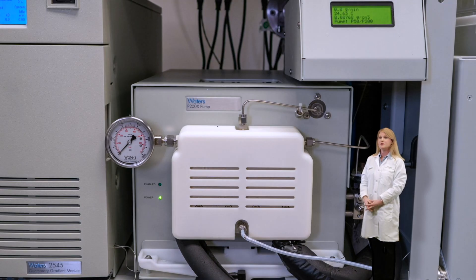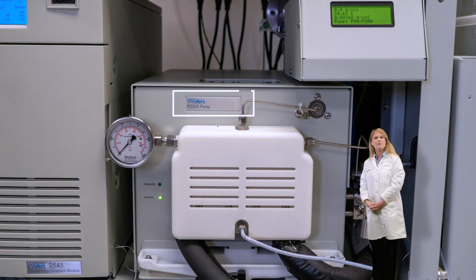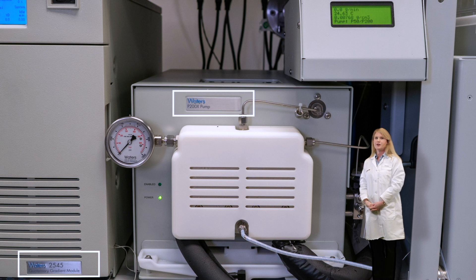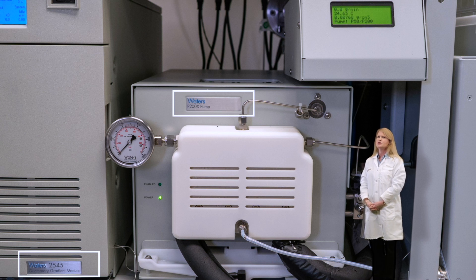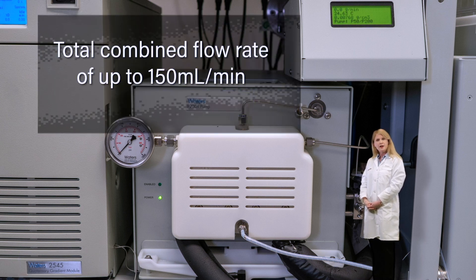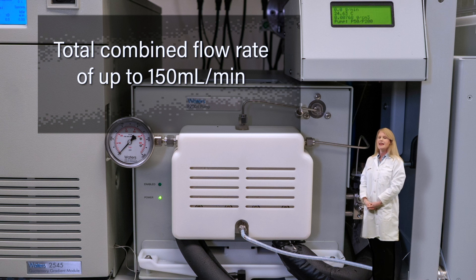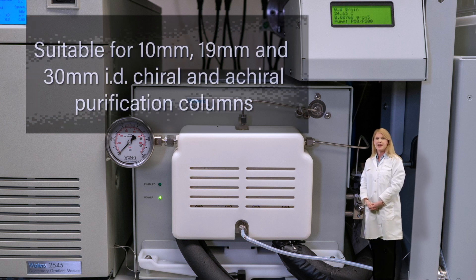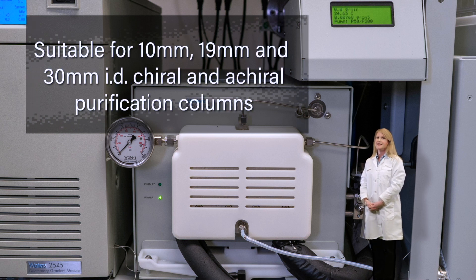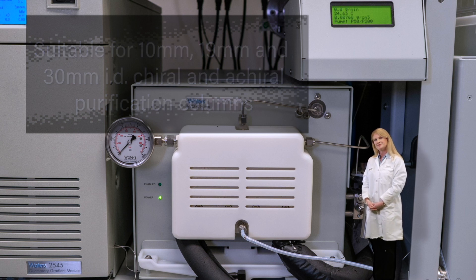The updated P200X CO2 pump operates in tandem with the Waters Quaternary Gradient Module to deliver a total combined flow rate of up to 150 milliliters per minute. These flow rates are suitable for 10 and 30 millimeter ID chiral and achiral purification columns.